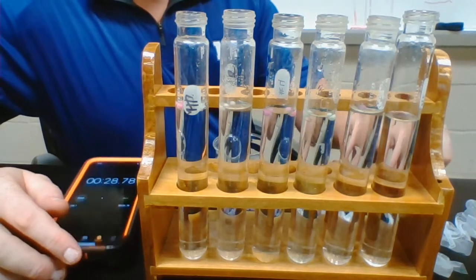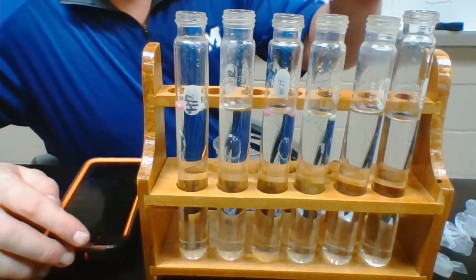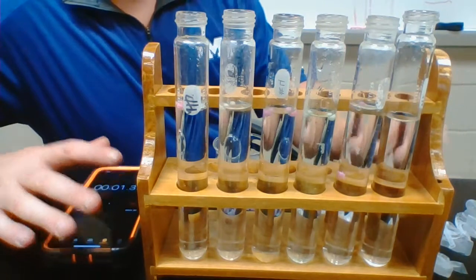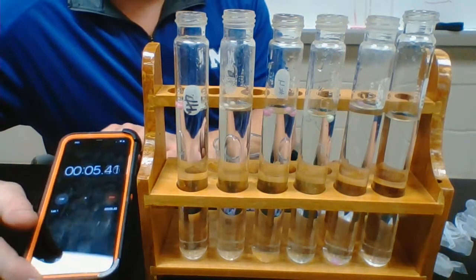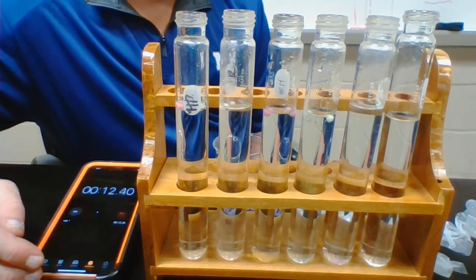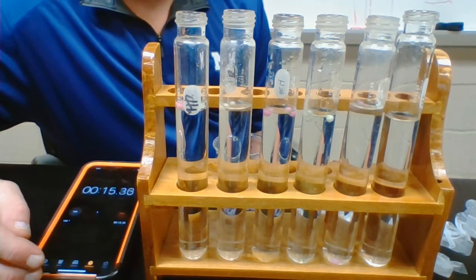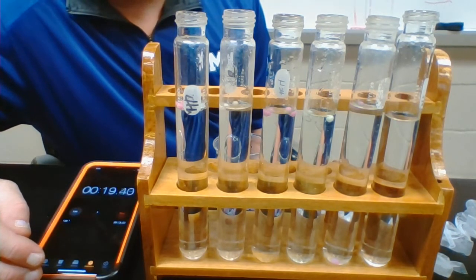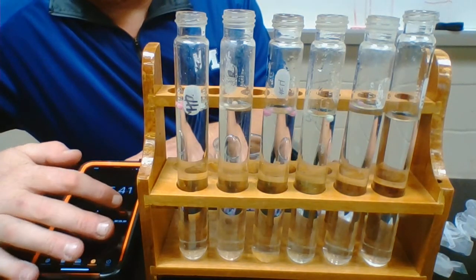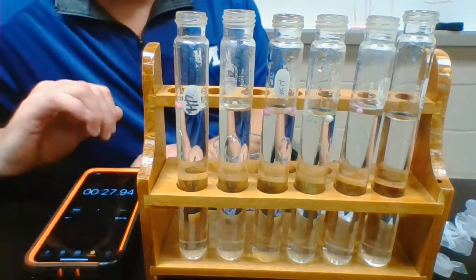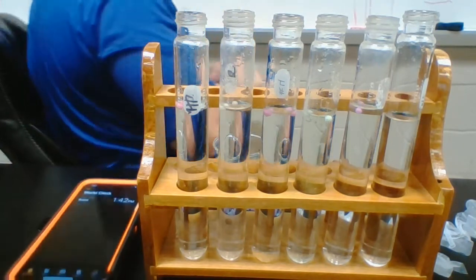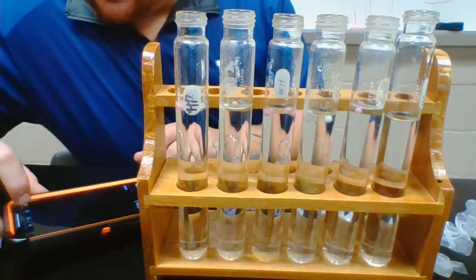Alright, we're going to do it again. Getting my lavender ready. Reset and one, two, three, start. Running, running from the strong base. I think my kid is watching some Russian language or Japanese show on YouTube right now. Alright, there we go, we're going up. And stop. So 27.94.